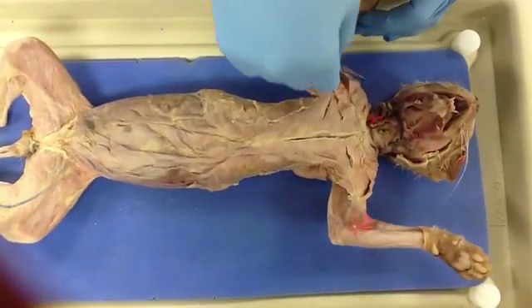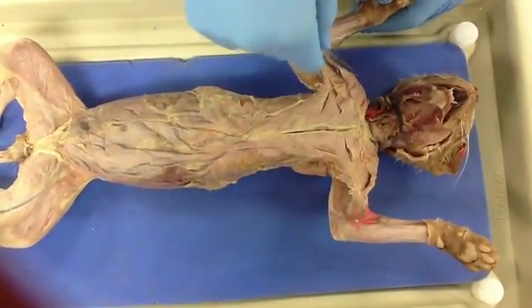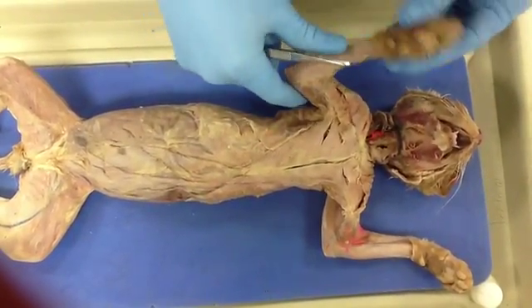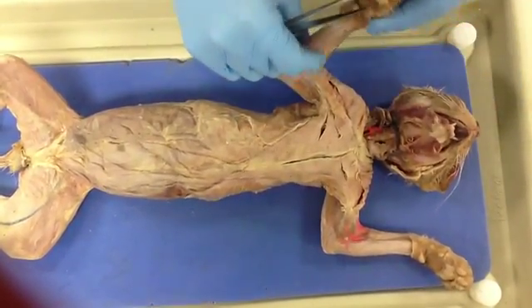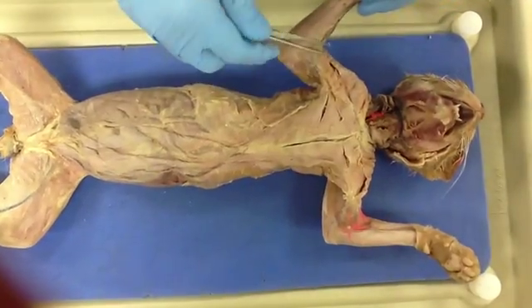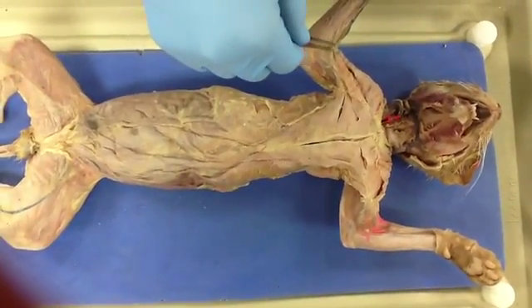And then when we get into the main body, this is the clavobrachialis, or the shoulder pad muscle, right here and here. Its function is to extend the humerus, like so, and flex the forearm like this. And as a cat's running, that is a very important muscle, because it would use it to pull its legs forward and run, actually. And its origin is in the clavicle, right here, and it extends all the way out, and the insertion is in the ulna out here.